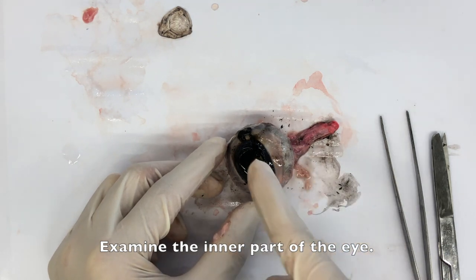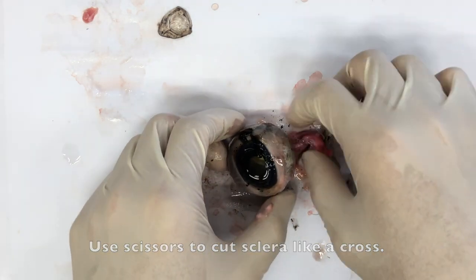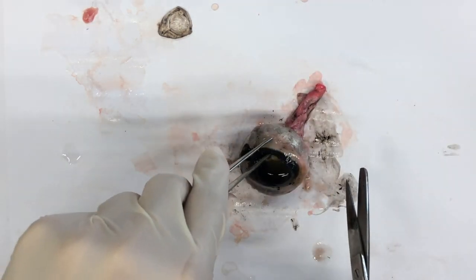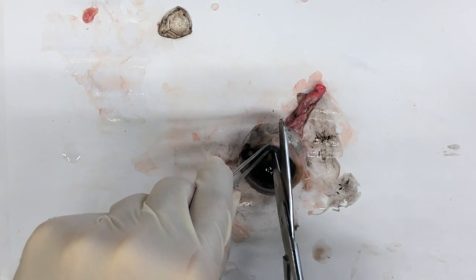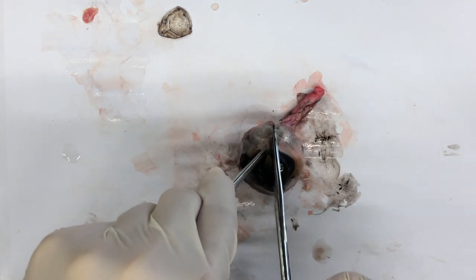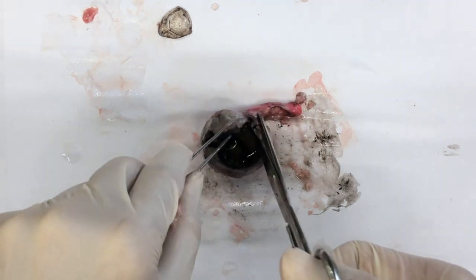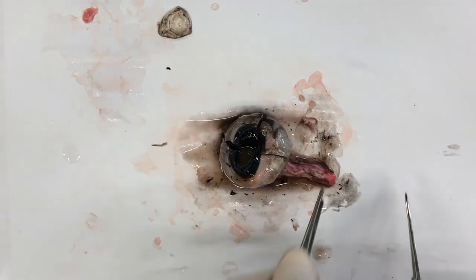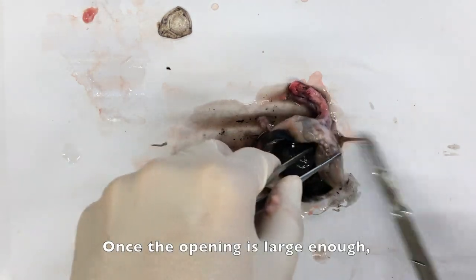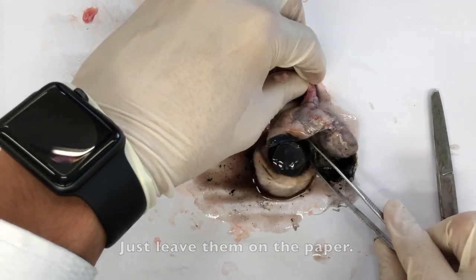Now we want to examine the inner part of the eye, and we will use scissors to cut the sclera like a cloth. Once the opening is large enough, the lens and the jelly-like fluid are about to come out. Just leave them on the paper.